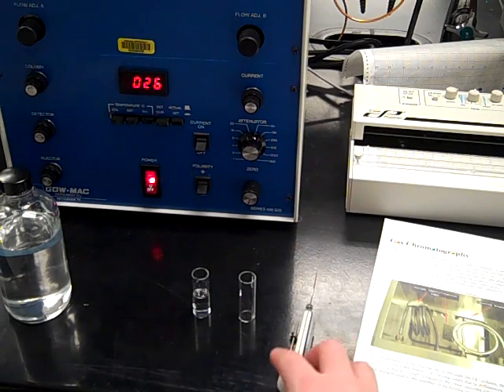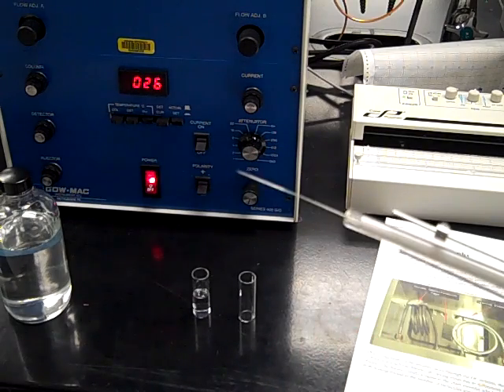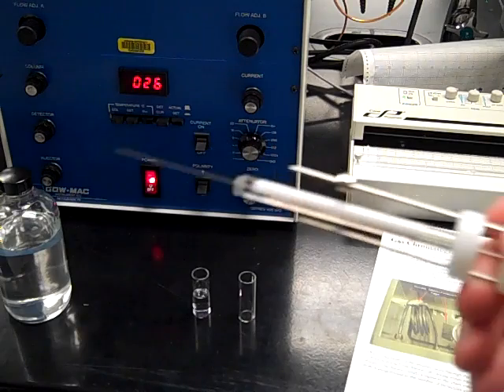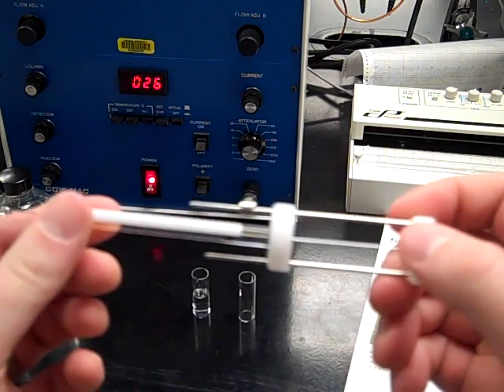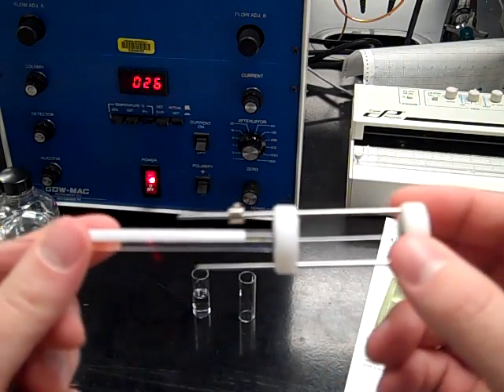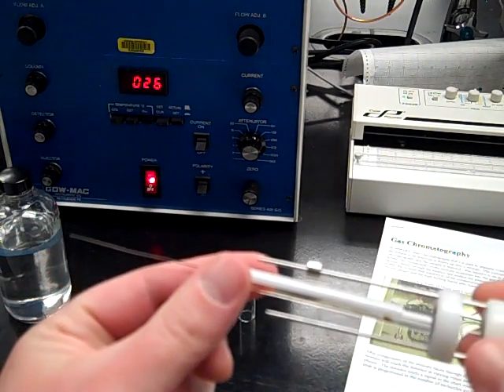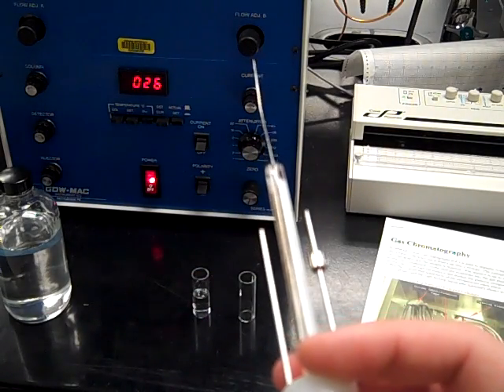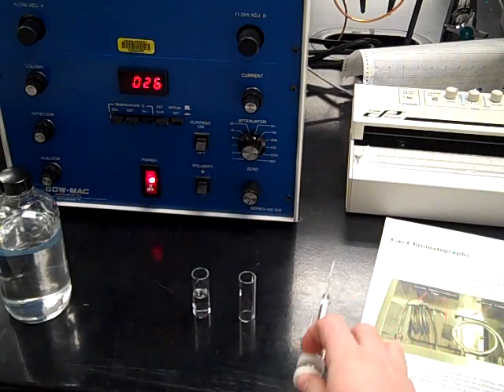We've also got our syringe. You can see this syringe has a fine metal point, and this has a guide so you can only pull it back to a certain level. This prevents bending of those metal parts. When you're using this syringe, you want to be really careful because they're not cheap and they're easy to bend.